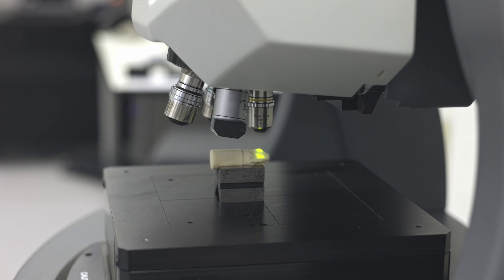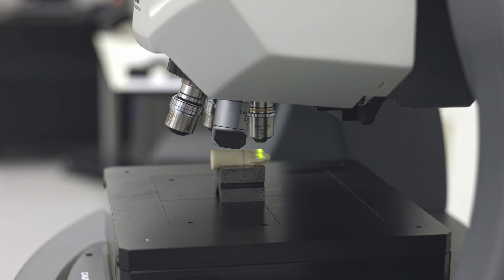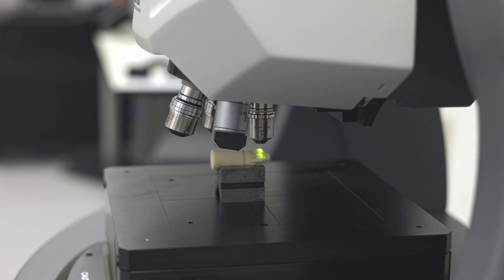Welcome to Metrology with Dr. Marv. Today we're going to take a brief look at measuring surface roughness.